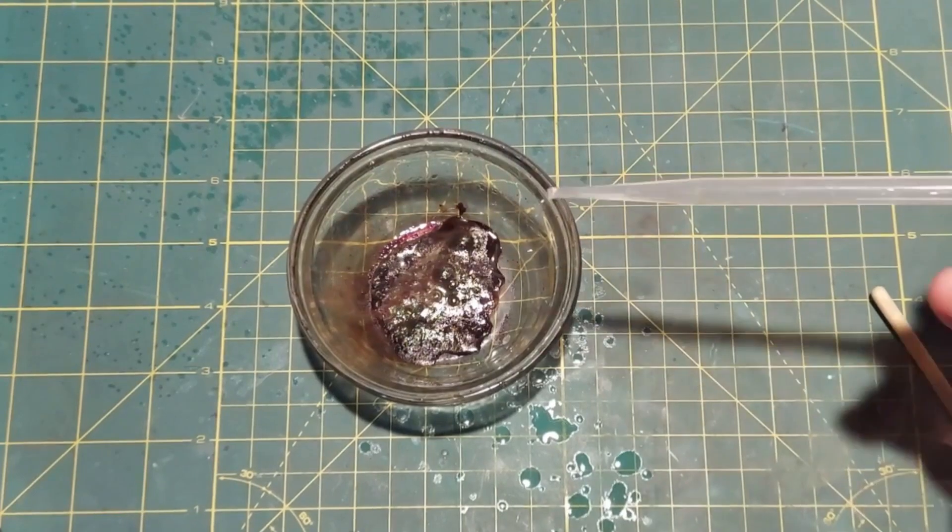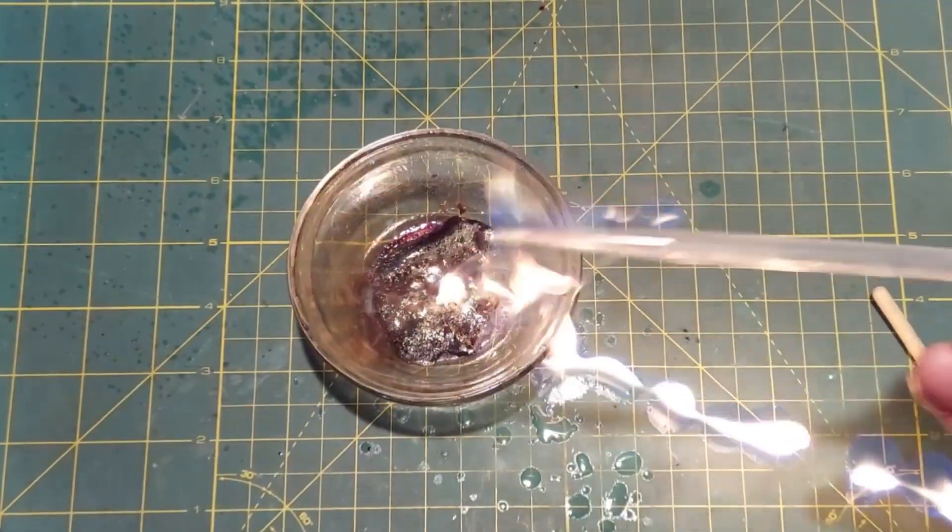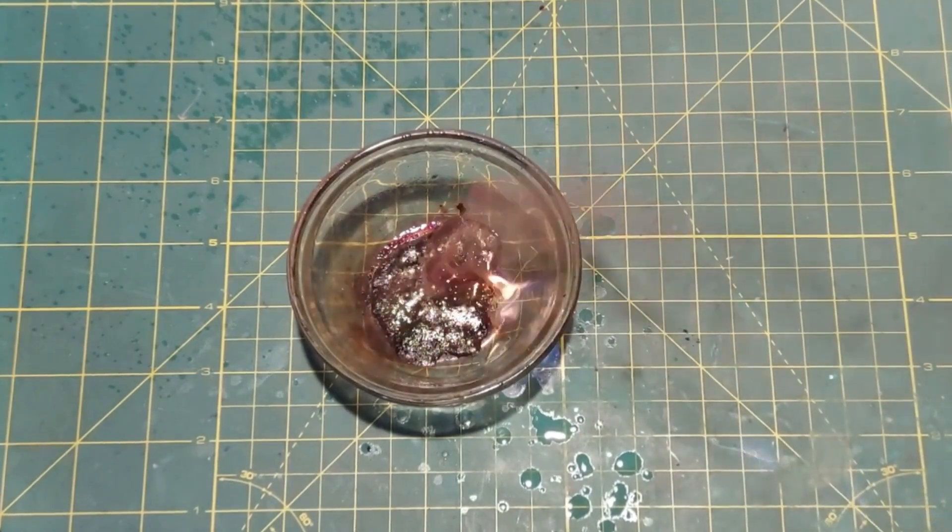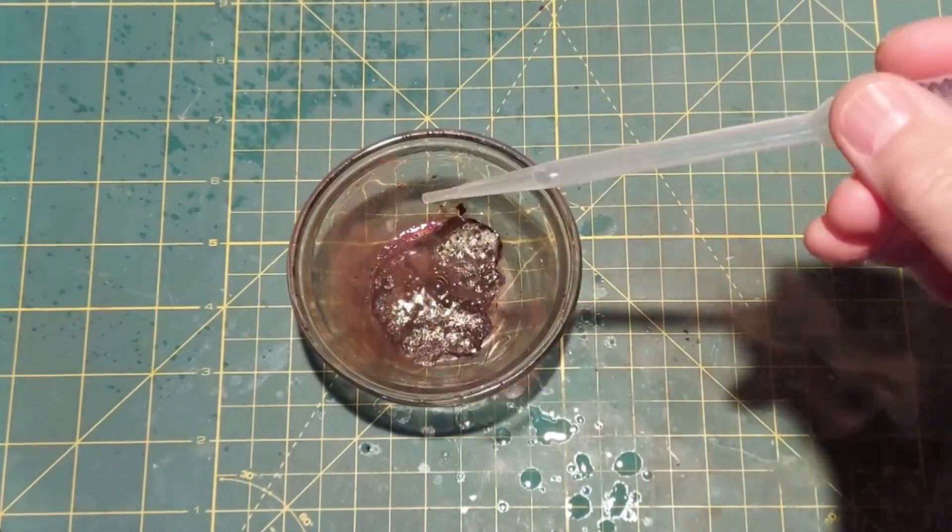I have some acetone here. Well, look at that. I'd say that's a little bit on the explosive side.